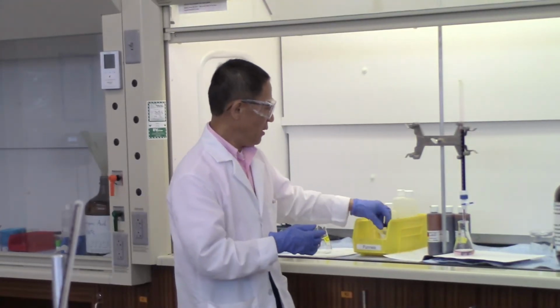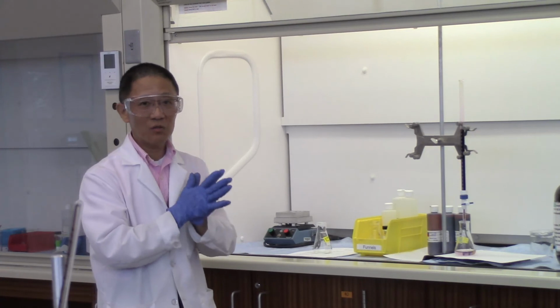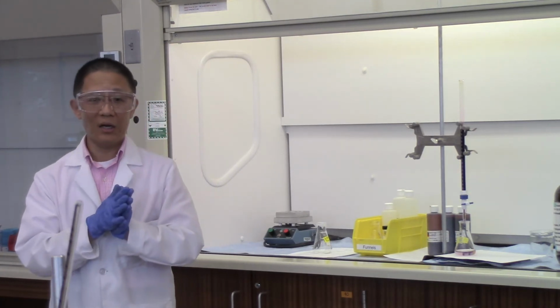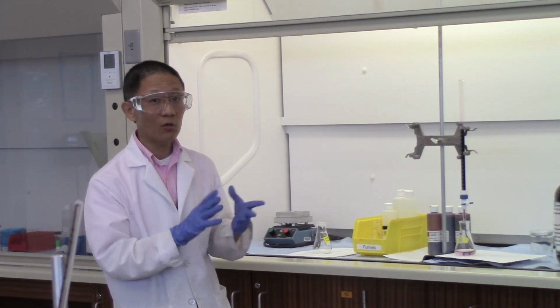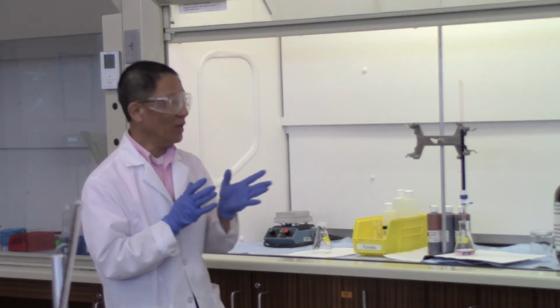So in a nutshell, this particular experiment, 6 titrations. 3 for the known part, trying to determine the molar concentration of the KMnO4. 3 for the unknown part, when you're trying to determine the percent of iron in the given sample. And again, the true value, you will need to ask your lab instructor, based on the unknown number of your choice, ask your lab instructor what is the true value. Once you have the true value, you got your experimental value, you calculate the percent error. And that is everything that we need to do in this laboratory.